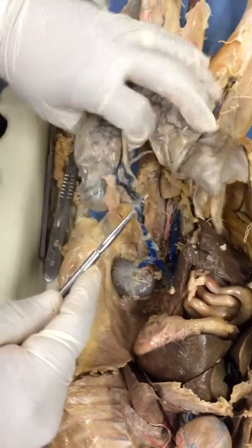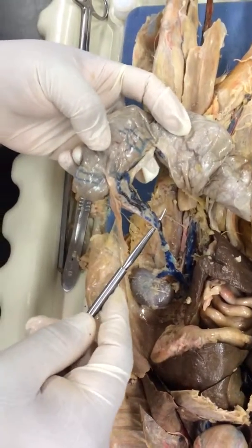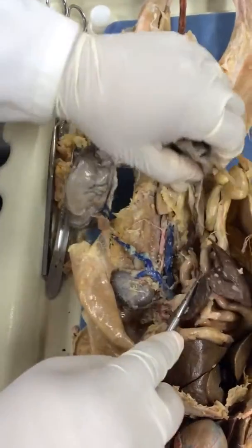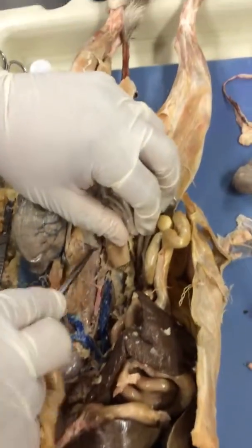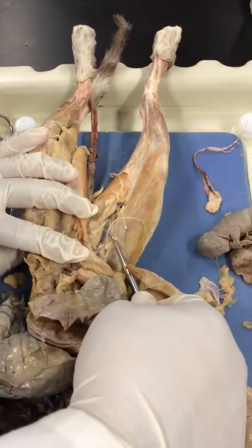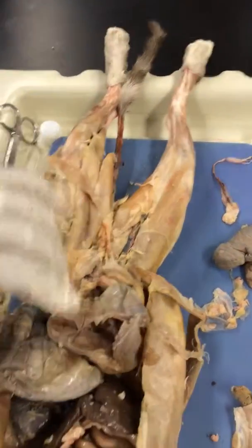What is this guy here? And obviously you see the pregnant... gonadal. The blue one would be the vein. The red one would be the artery, right? And then it gets hard to see. But if we come over this way, this vessel here, the red one, femoral artery, blue one, femoral vein.